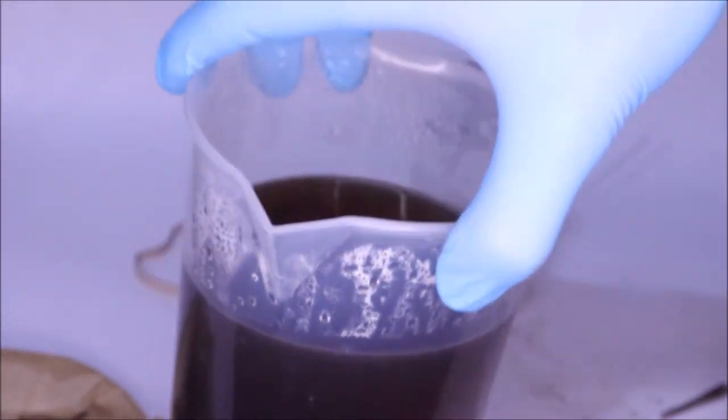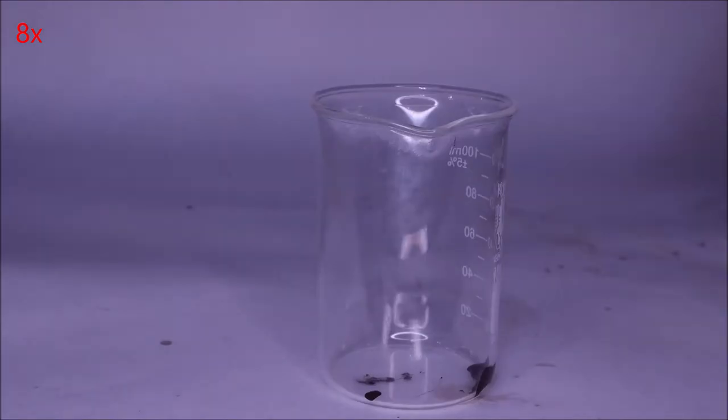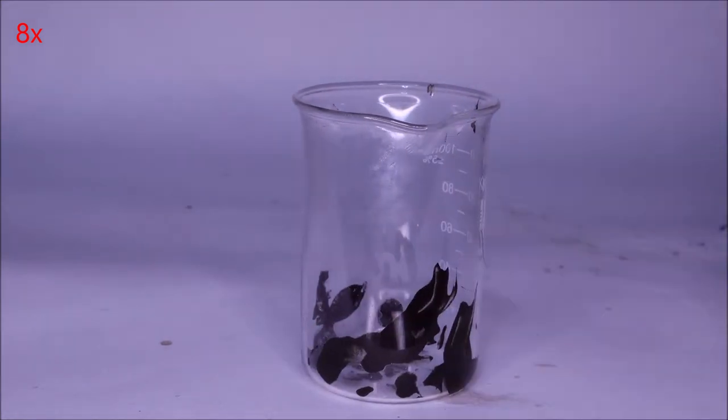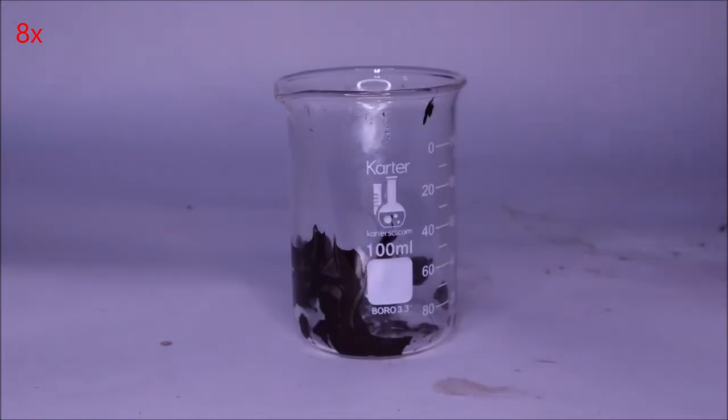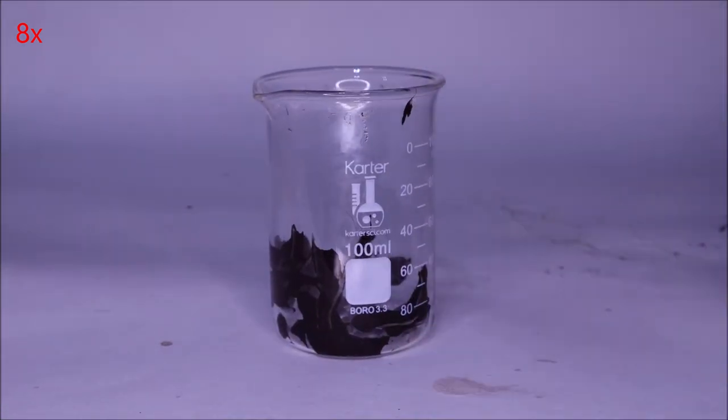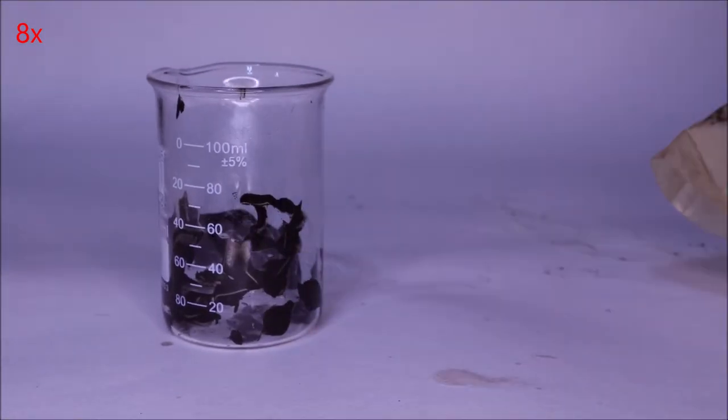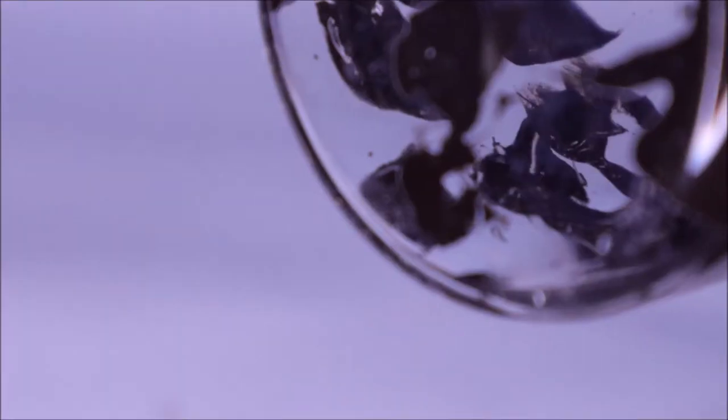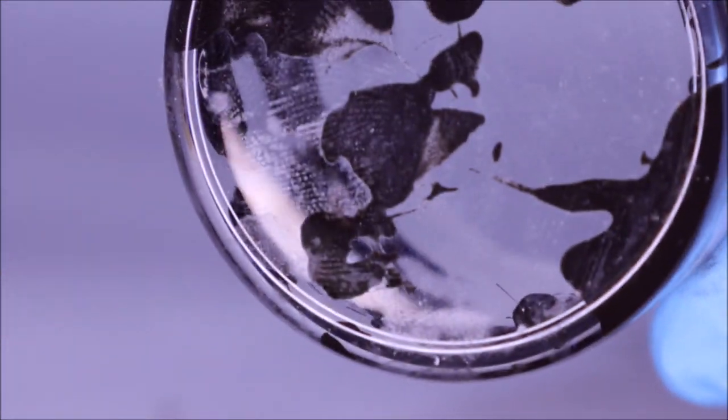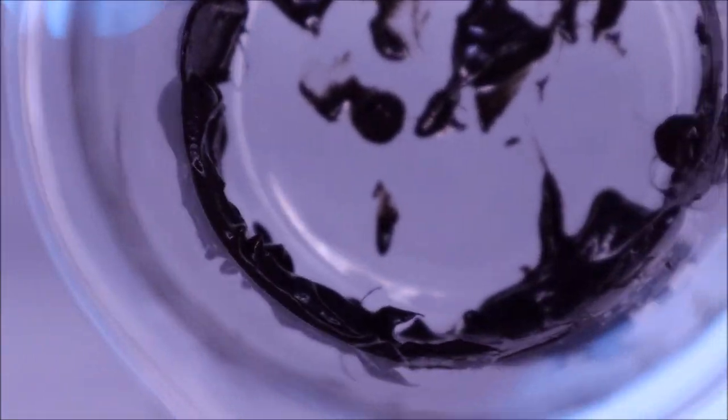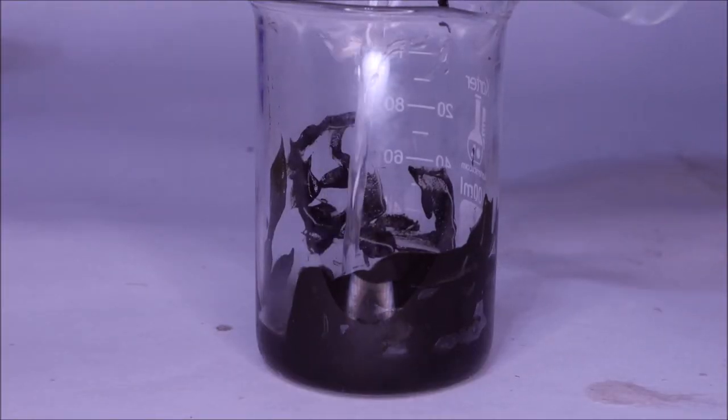The neutralized solution is of course fairly nasty. I then carefully loaded the Griffin beaker with the tar-like substance that had been filtered off, which of course used to be my hair, which is still kind of weird. It's really gross to work with and it smelled pretty bad too. It kind of still smelled acidic to me, but also kind of like old hair. It was just very, very unpleasant. At this time I had all my doors open.